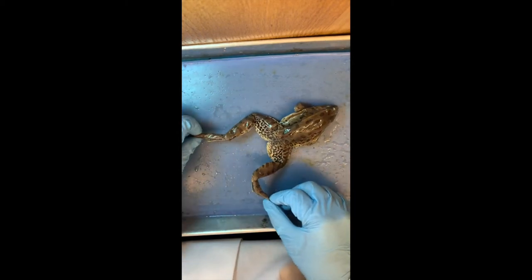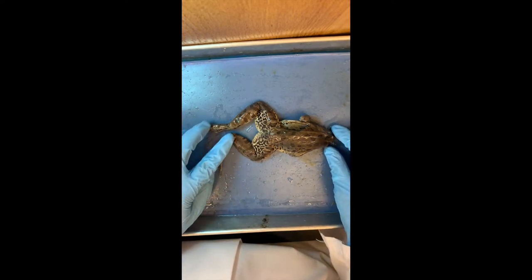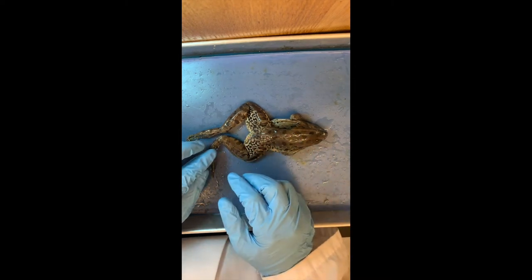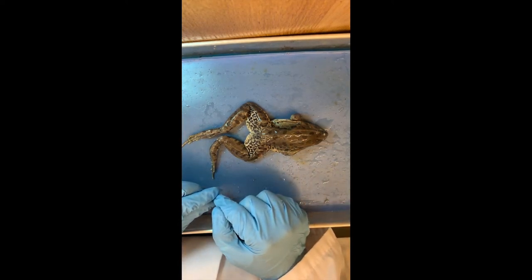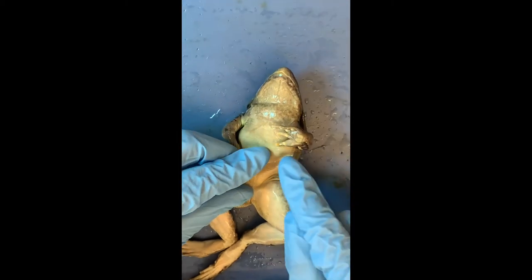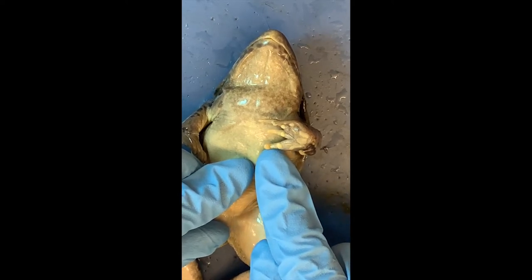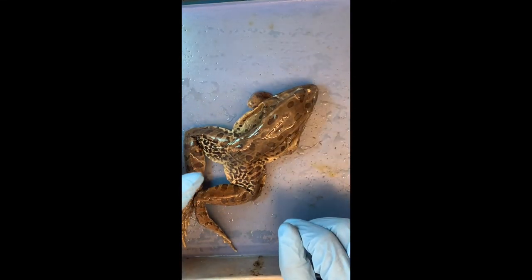Males and females are sometimes hard to identify, but usually the female is larger because she needs energy to make eggs. The males are smaller, and for mating they usually will be on the back of the female. As she lays her eggs, he fertilizes them with his sperm — external fertilization. The males usually have a thumb pad to hang on to her, which I don't really see here, so I'd suppose this one is a female. The thumb pad is used so the male can hang on, and they stay like that for days — the poor female has to carry the male around.